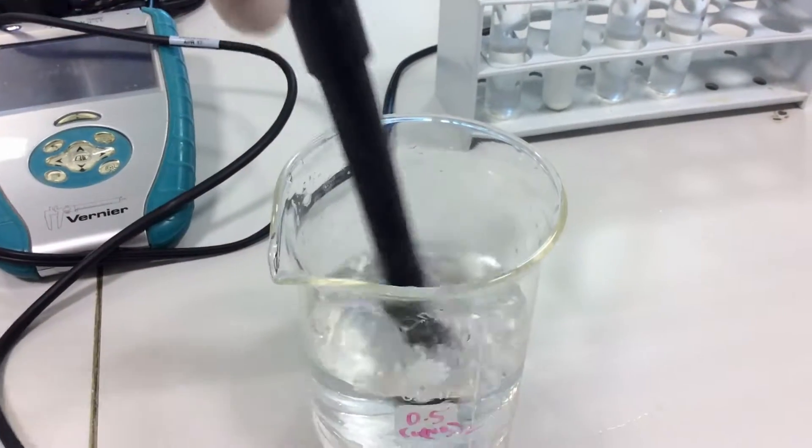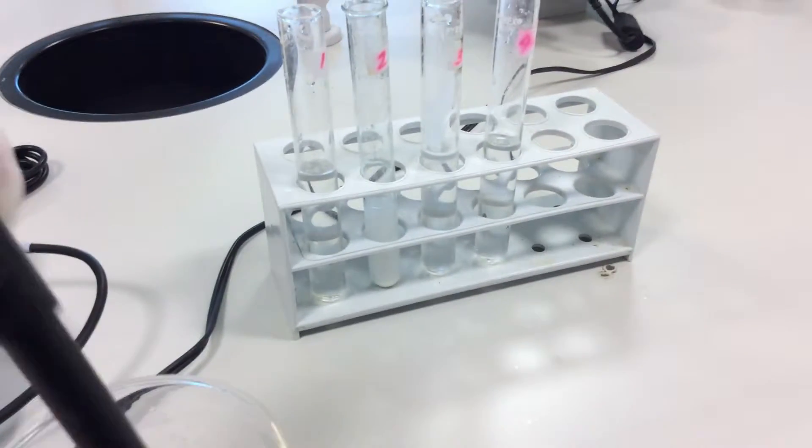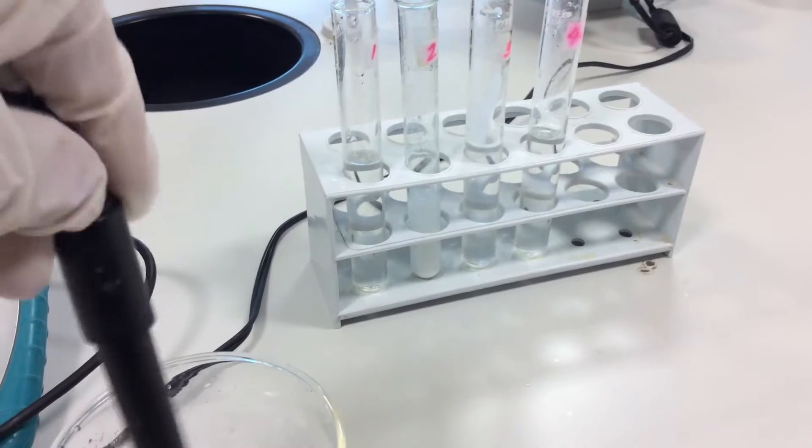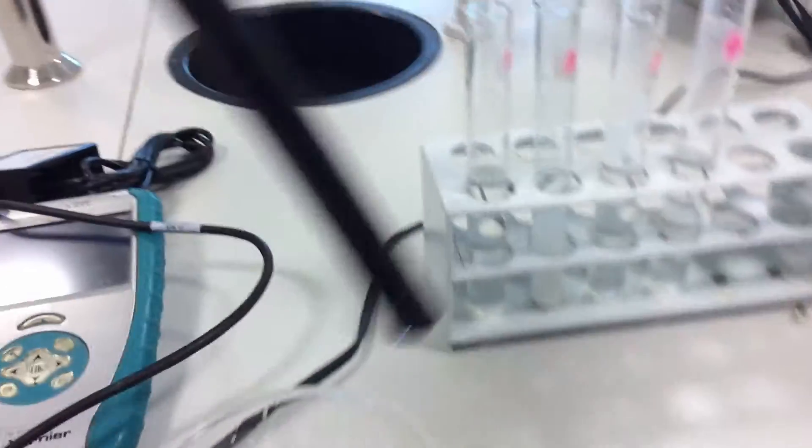And finally, the conductivity of glucose.